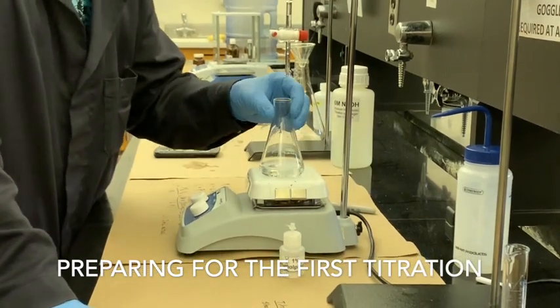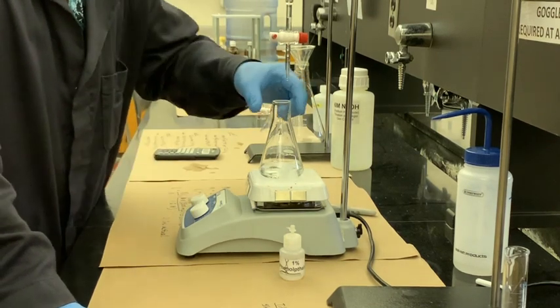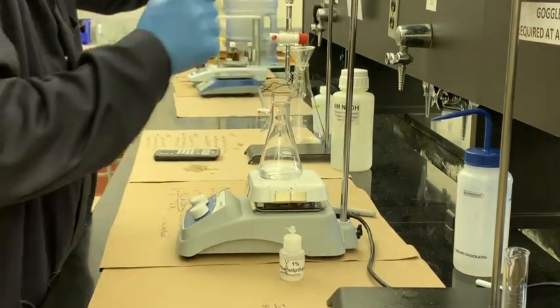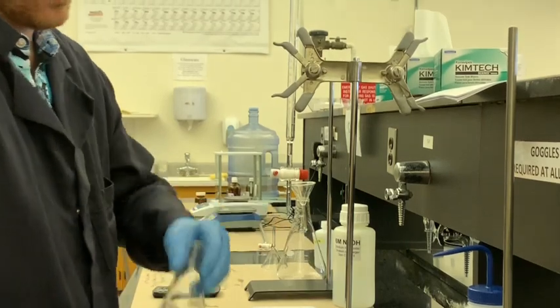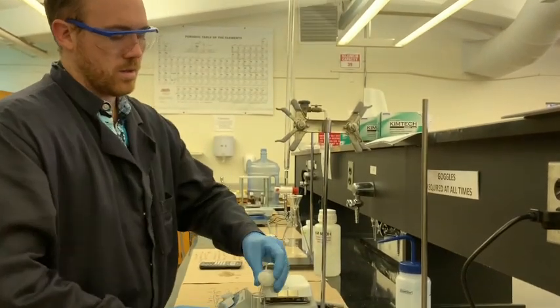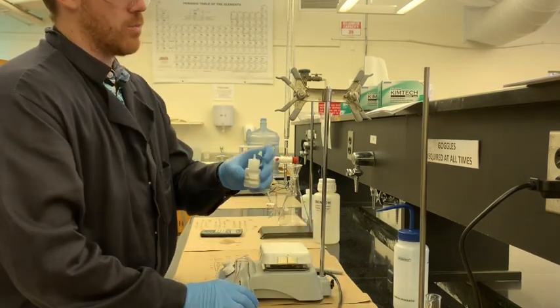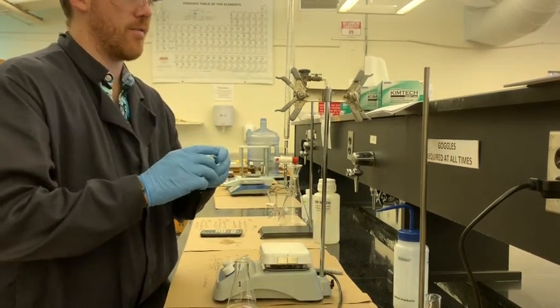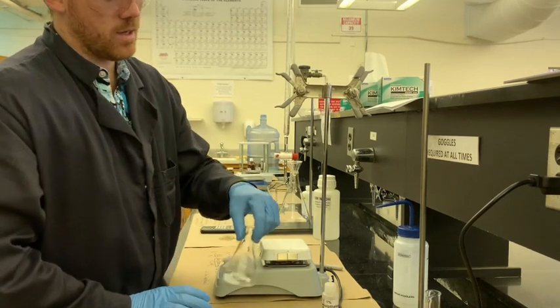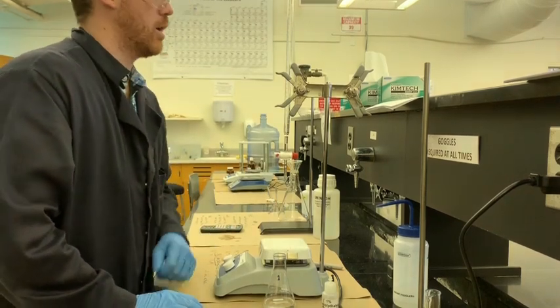All right, so we're ready to go on this titration. We have everything fully homogeneous in this Erlenmeyer flask with our stir bar. We've been stirring it for about 10 minutes at this point. And we have our burette, which is above the flask. So what we're going to do first is take a couple drops of phenolphthalein and add them to our flask. You don't want to add too much, but it doesn't matter that much. You just want to make sure that you have enough to see the color. There's going to be so little of this in here that it won't really affect the concentration of the NaOH or the acid that's being titrated.